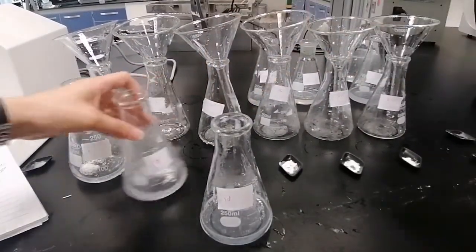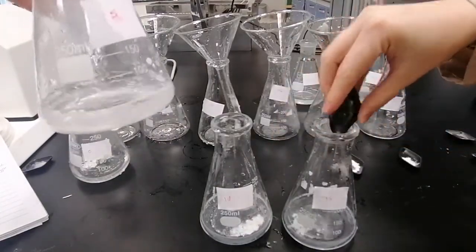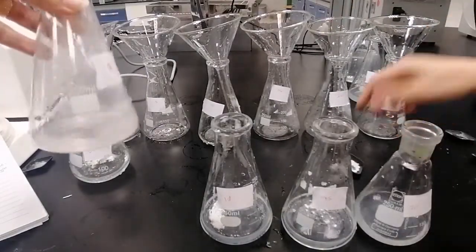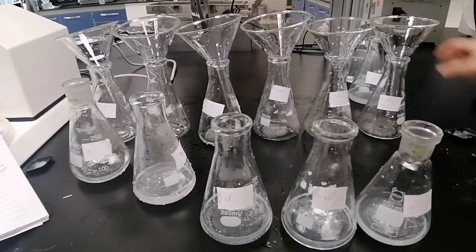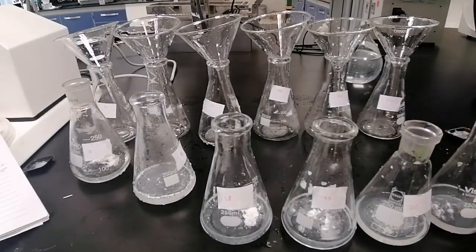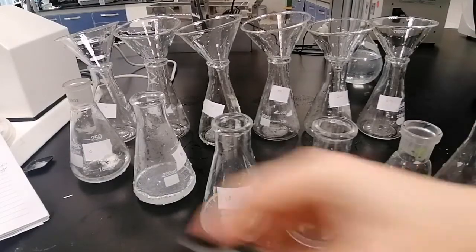As you can see, mefenamic acid is still insoluble and forms a second layer on the surface of the solution. In order to increase the interface, we will use the shaker here. As we said, the shaking will be used for 15 minutes. Then we will filter these solutions in order to get rid of any undissolved particles.